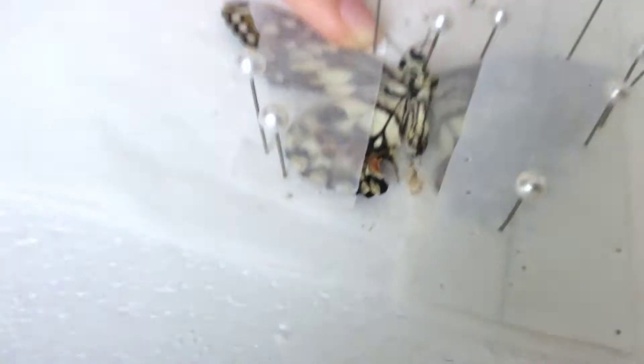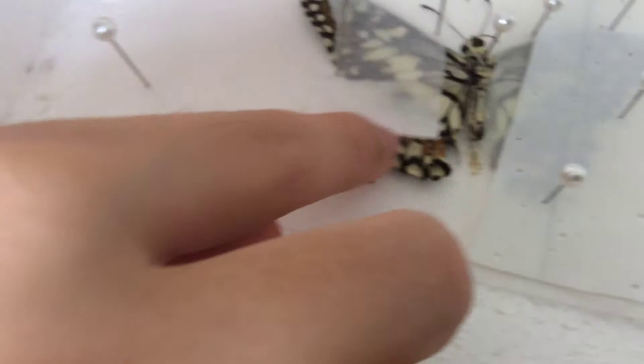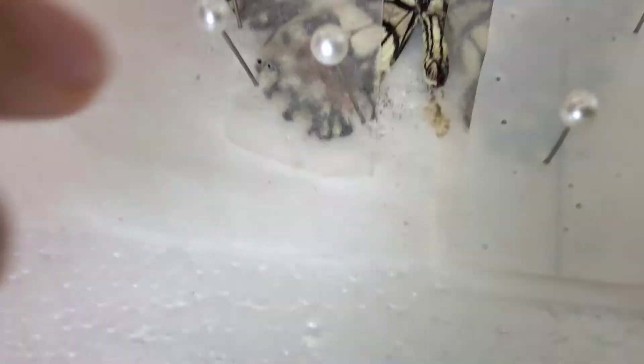Now, this is an unnatural state, but it looks a little nicer like this. Whenever you're going to buy a dead butterfly, it's probably going to be in this state. So you're going to do that to both your hind and your forewing. Even if your wings are deformed — a slight deformation like this can still be mounted, but if it's a very, very big deformation, the tendency to be mounting it isn't so big.